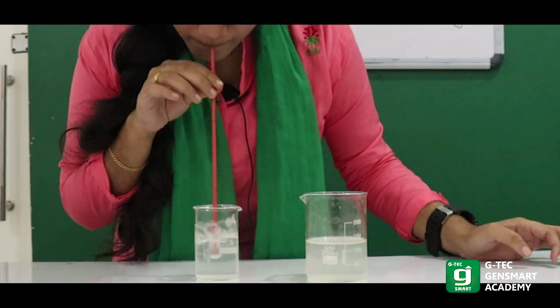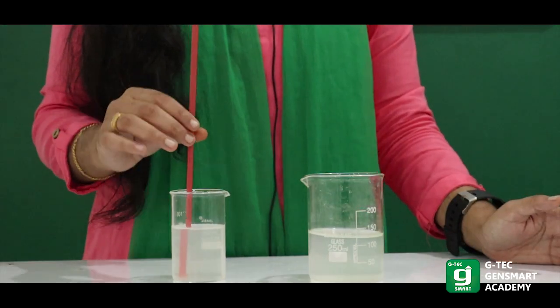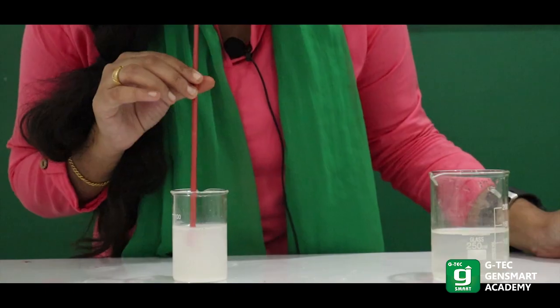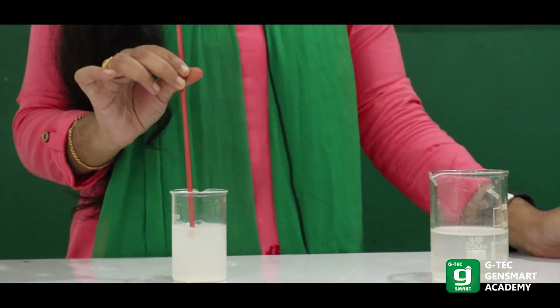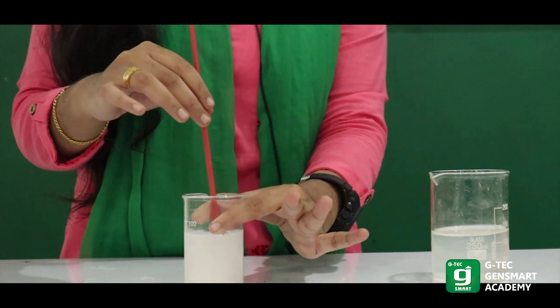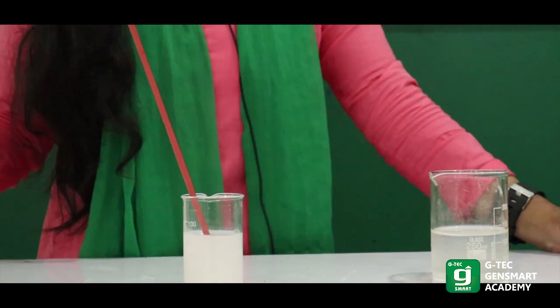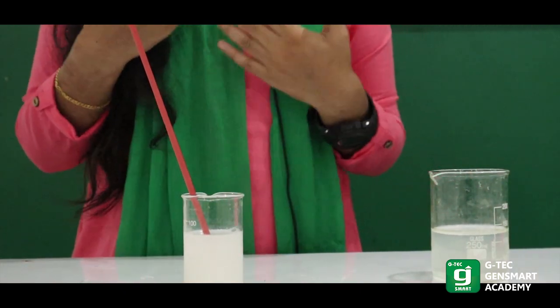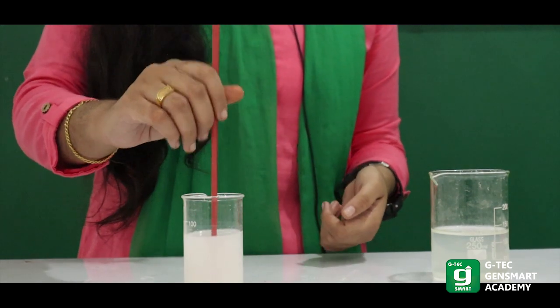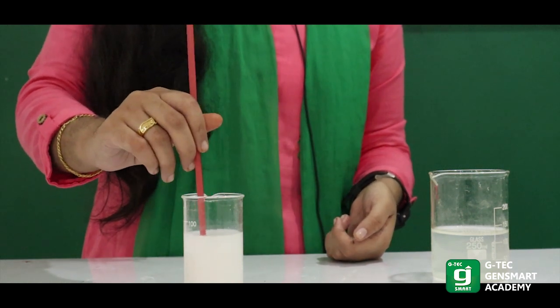Continue blowing. And after that, we will get a result — that is, a white precipitate forming. When we blow it, we will get a white color precipitate. In the respiration process, we are adding carbon dioxide. This calcium hydroxide solution will turn milky — that is, white precipitate — and it turns into calcium carbonate.